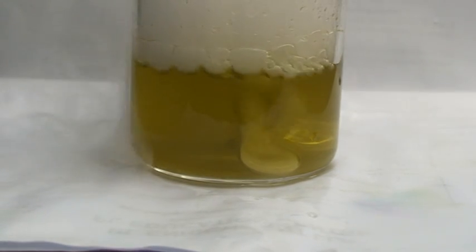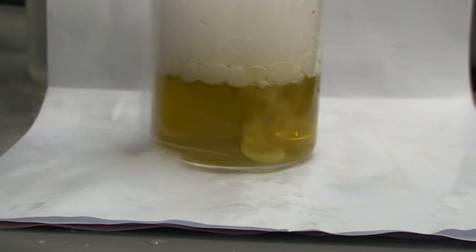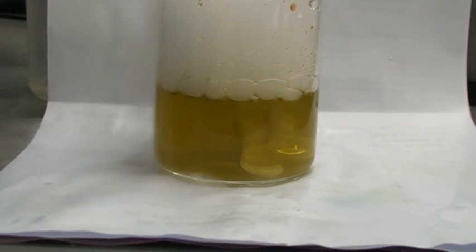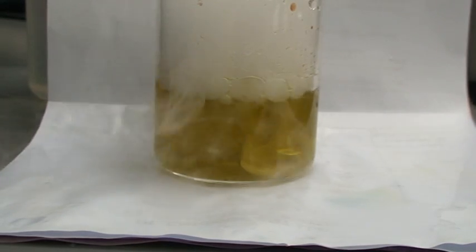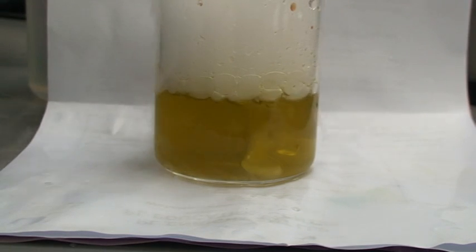So with that dry ice, you can actually perform quite a lot of experiments. Apart from converting it to liquid carbon dioxide. You could actually put in phenolphthalein. If you put in phenolphthalein, you will start as pink in the calcium hydroxide, lime water. And then after that, you change to colorless. If we have some more solid dry ice, we will do that afterwards.